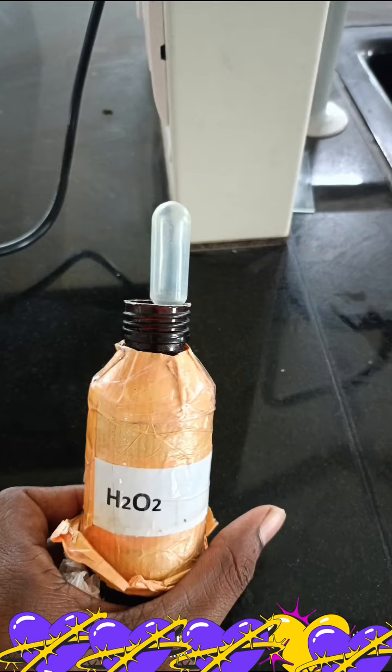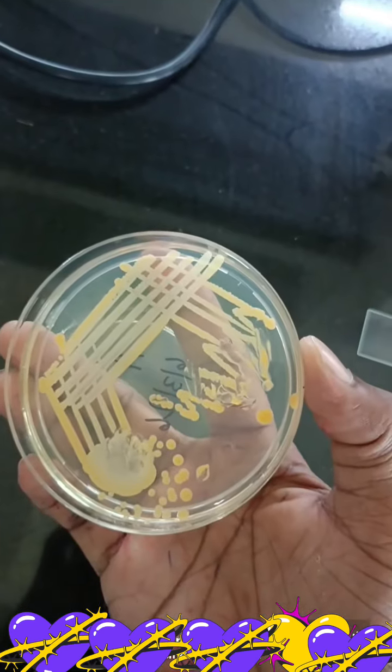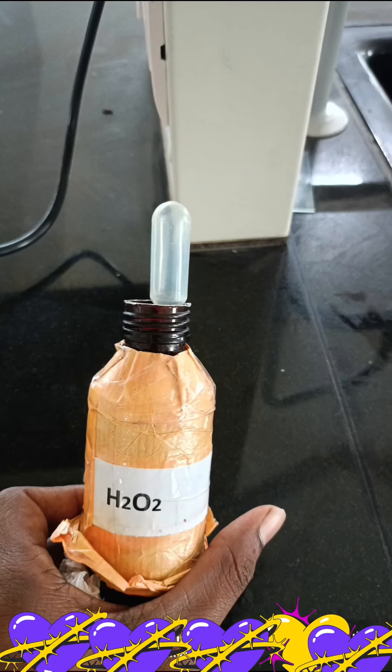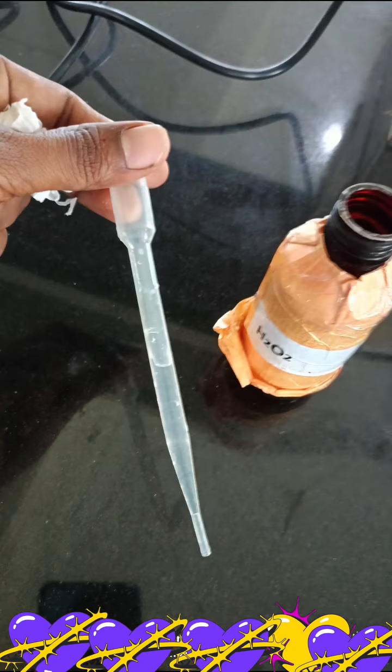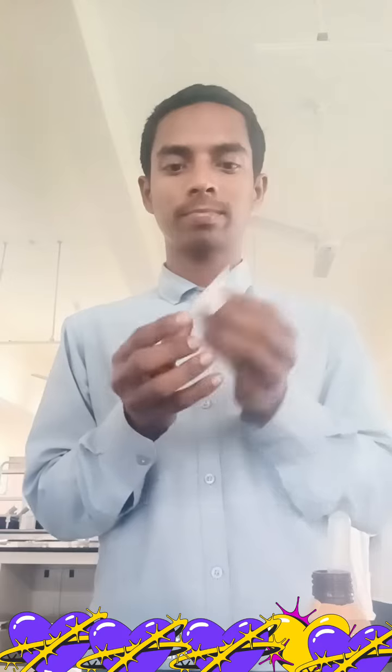Now, for performing this test, we require clean glass slides, 3% hydrogen peroxide, a fresh bacterial colony, and cover slips. You can see this is hydrogen peroxide. This is a dropper transfer pipette. This is the bacterial culture. The procedure of this test: first I took a clean glass slide for the Catalase test.